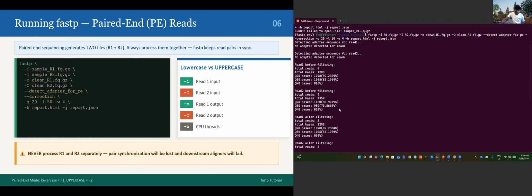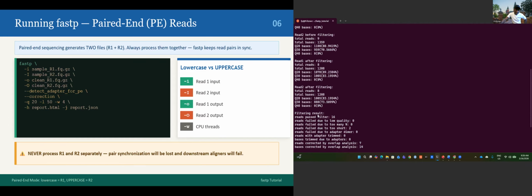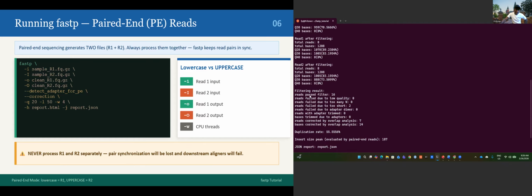You will see the same report. It will give you no adapter detected for read one, no adapter for read two. That's good. Read one before filtering 9 reads, and read one after filtering 8. Read two before filtering 9, read two after filtering 8. And in the filtering result, you have 16 reads passed the filter, and two failed due to being too short.